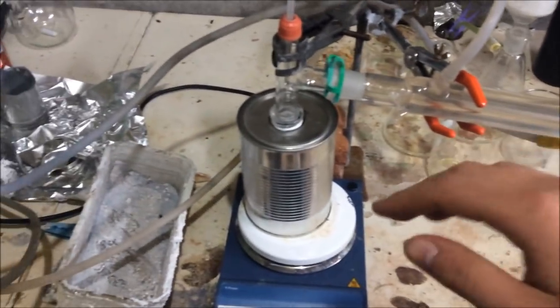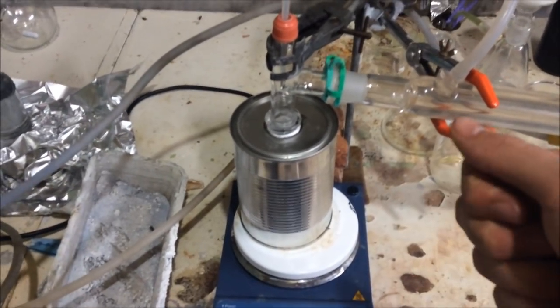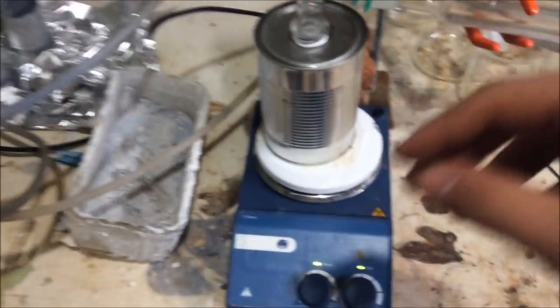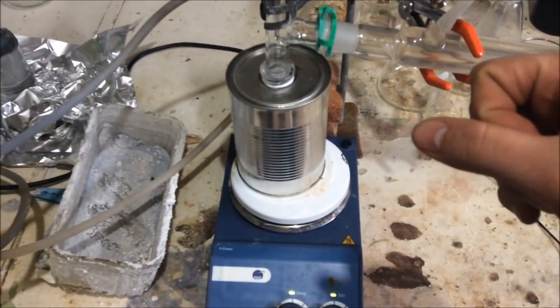Hold on, let me get this right. Sodium terephthalate. Anyway, you know what the compound is. It'll be in there. And then we add some more sodium hydroxide. We heat it up until the sodium hydroxide melts. It'll start to decarboxylate the sodium terephthalate.